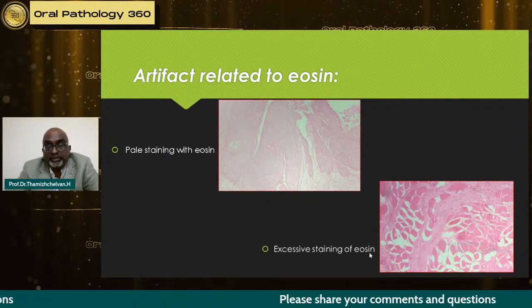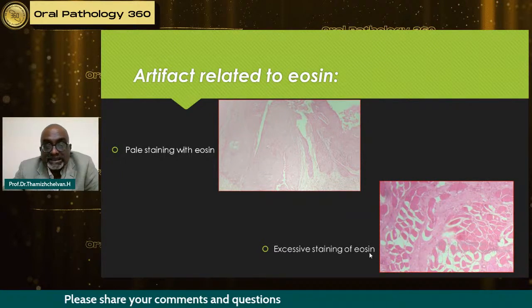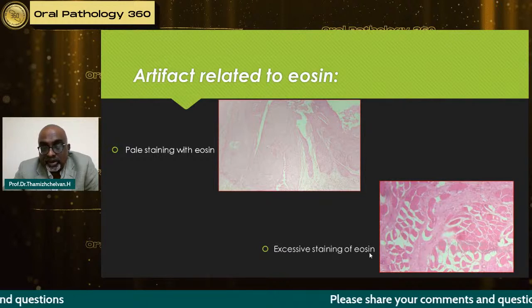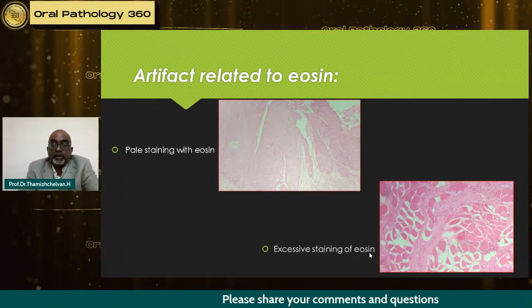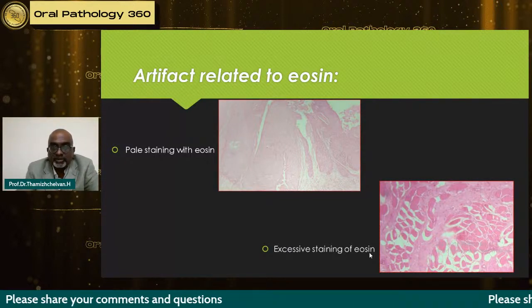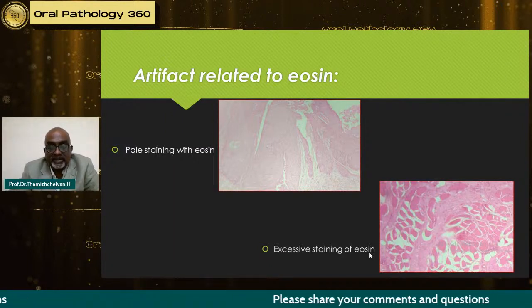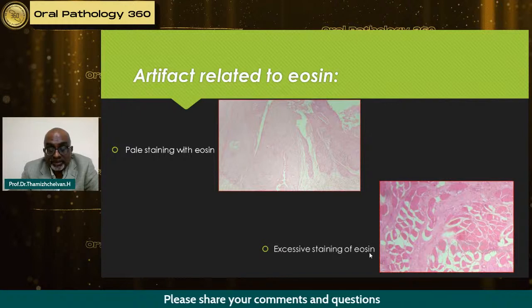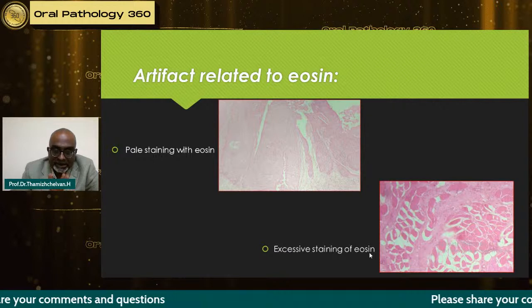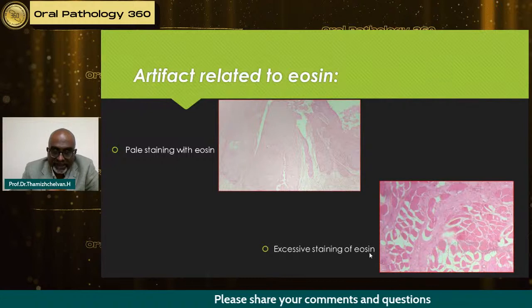And there are a few areas where we don't see proper bluing because of pale staining with eosin or excess staining with eosin. The proper ratio of hematoxylin and eosin is a must, because when these cases go for projects or publications, the patient's diagnosis will be fine, but the acceptance process will be a little difficult. So that's the reason I'm putting pressure that the grossing in-charge staff should sit with the technician and make sure they are properly trained.